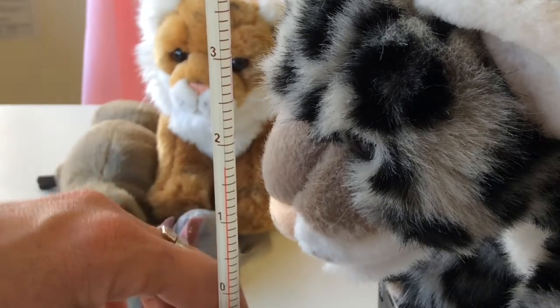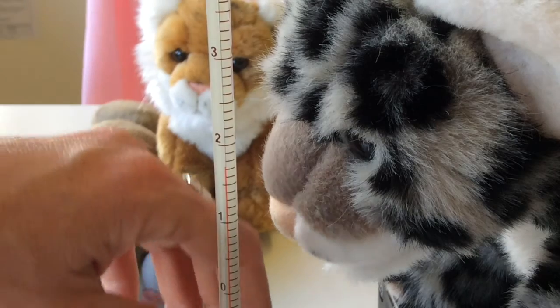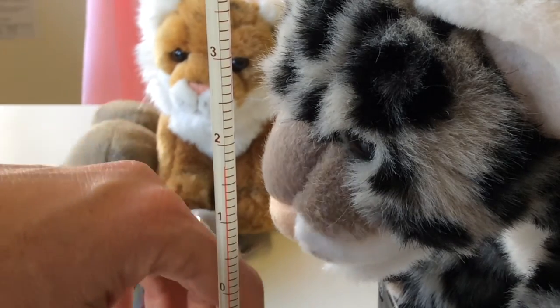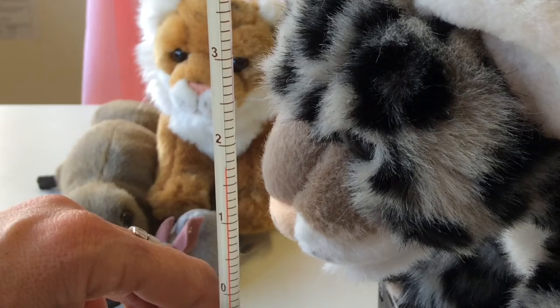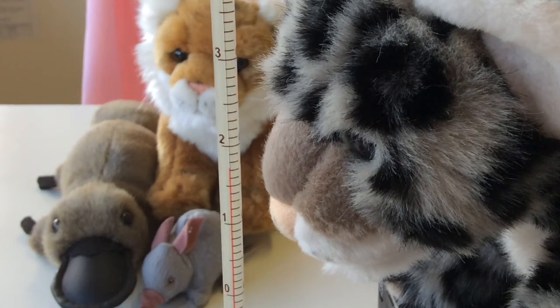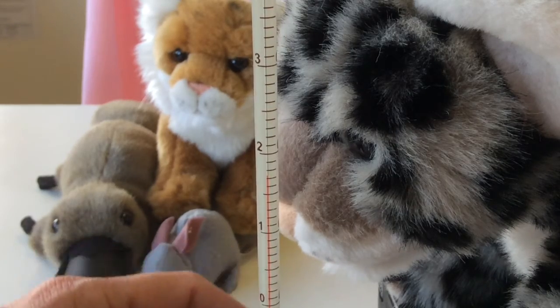I've added the 100 ml of water into the calorimeter, just waiting for the temperature to become constant. Once again, I used distilled water, so it was sitting in the science room, so it should be pretty constant anyway. I can't see that it's really going to change much. So we'll just give it a little bit of time.